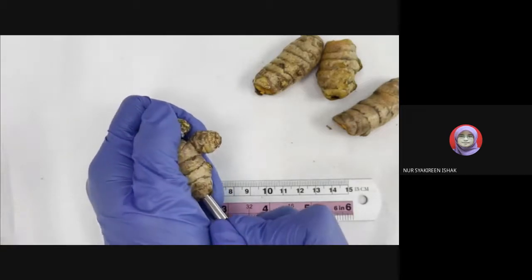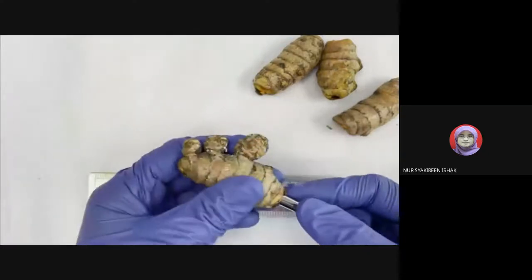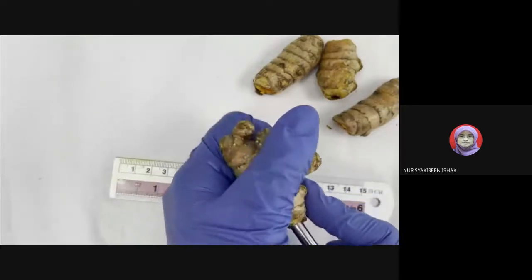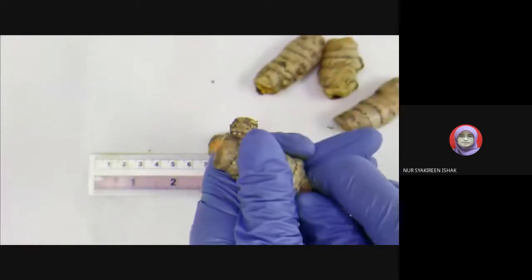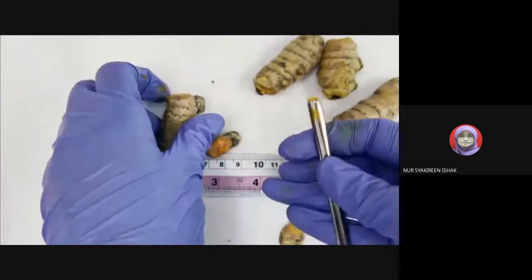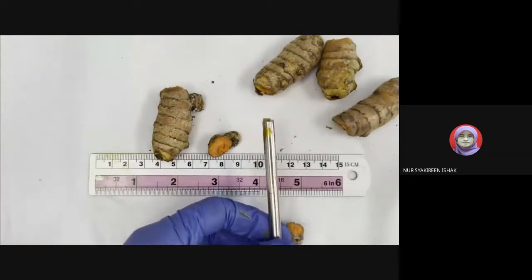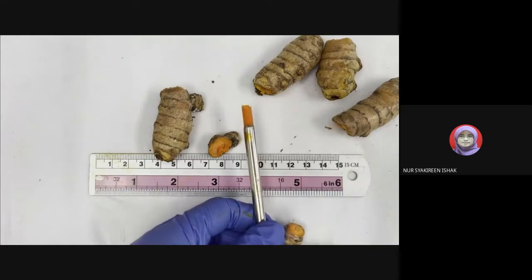Hold the turmeric with your left hand tightly, and by applying force, I mean a lot of it, start the process by pushing down the cork borer through the tuber. Take out the borer and then use the solid pin to remove the fresh cylinder tissue out of the borer.